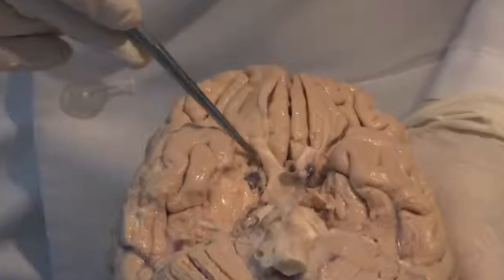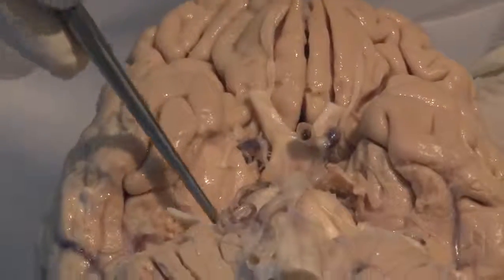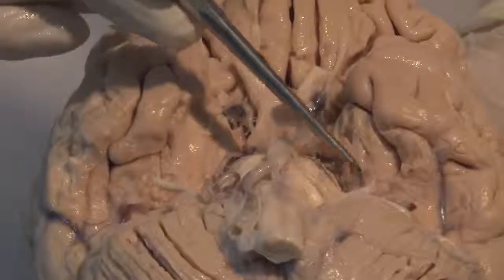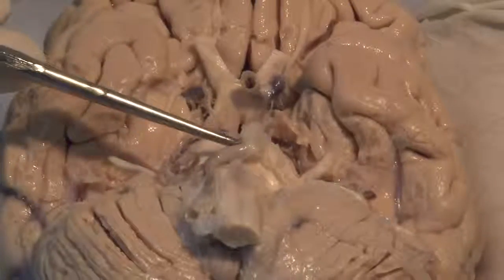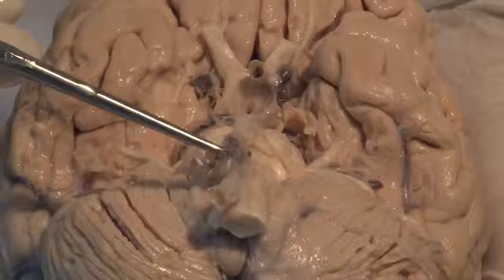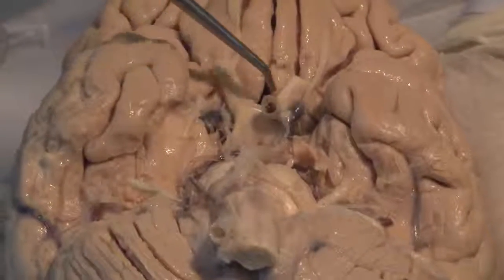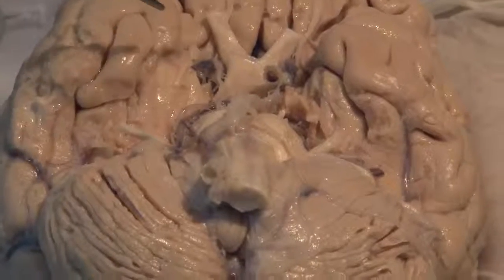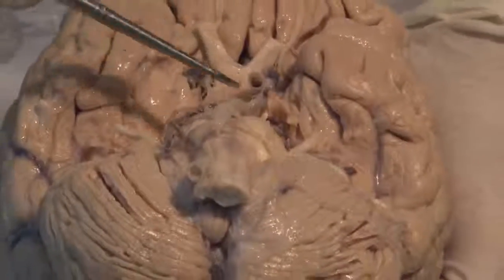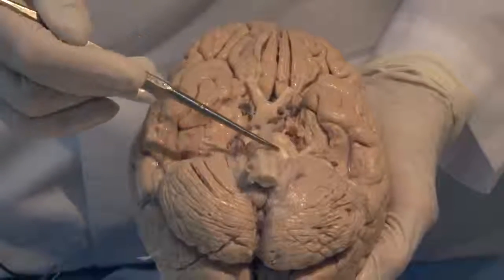Cranial nerves are attached, such as the visual optic nerve and the sensory nerve from the face, the trigeminal nerve, and blood vessels, such as this large basilar artery, are running on the surface. Or you can even see the large internal carotid artery. We will come back and look at the nerves and the arteries and the other connections in greater detail.